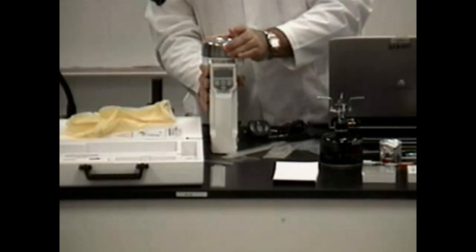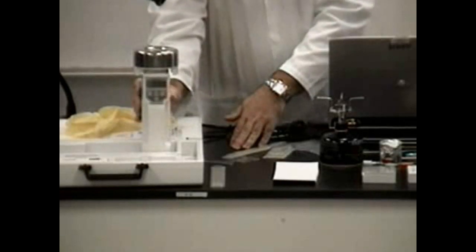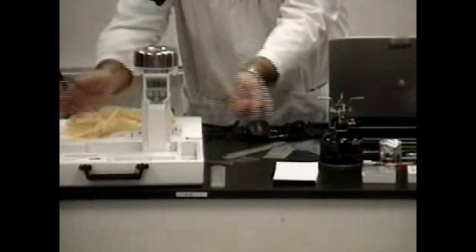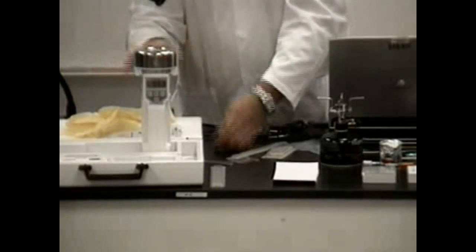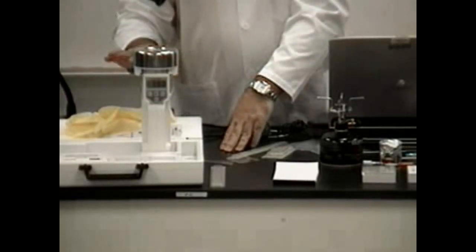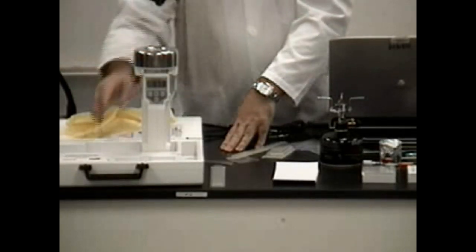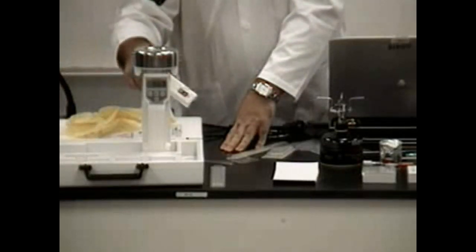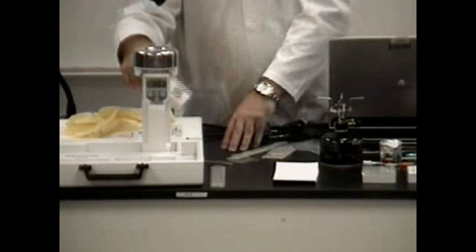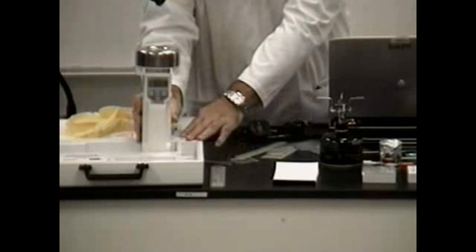We put the cover back on and lock it into place. We turn the power on—set for 1,000 liters to sample. It's drawing air into the top of the sampler and expelling it at the bottom, but before it comes out it spins the air at such high velocity that it throws or impacts any particulate onto the surface of the agar strip. If any of those particles are viable or living contaminants, they will grow on that agar strip. It also has a remote control so you can place it inside a hood, let the air settle, and turn it on without the person affecting the environment.